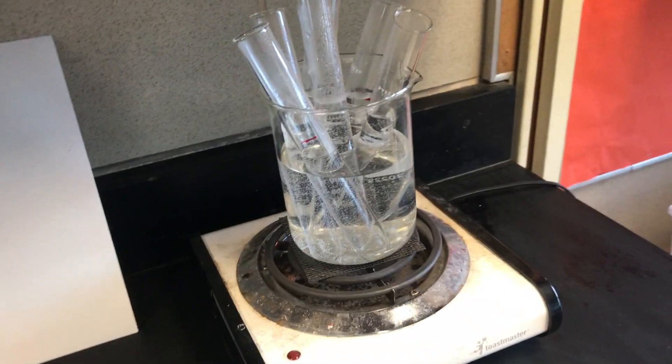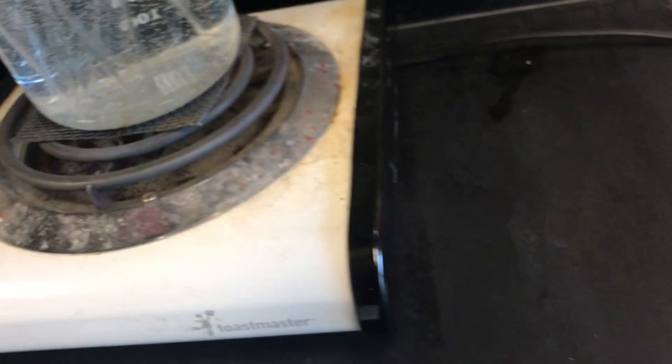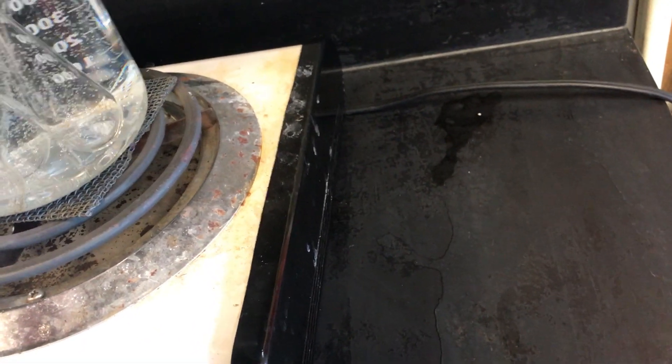Then I'm going to be the one who gives you the test tube. In this case, these have cooled off a little bit because I've done this a couple of times.